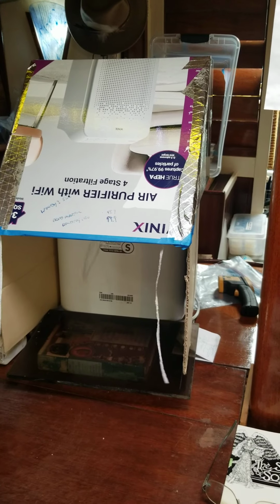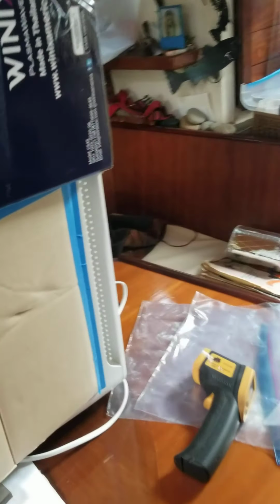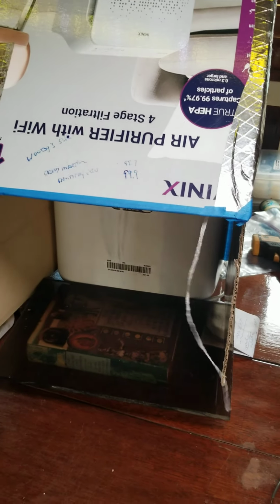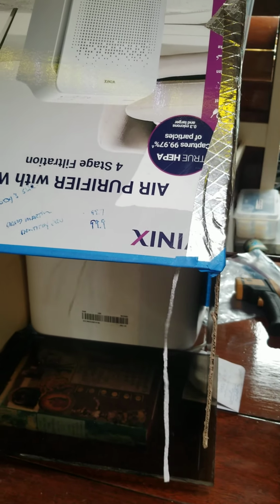And I just did that by taping the one filter onto the air intake screen so that it sits on top. And so the air goes through one filter, then it goes through the pre-filter, and then it goes through the main filter. And you can see from my telltale ribbons here, I get a good strong airflow, and I've had this working for about 10 days now, and I have inoculated dozens of agar jars.